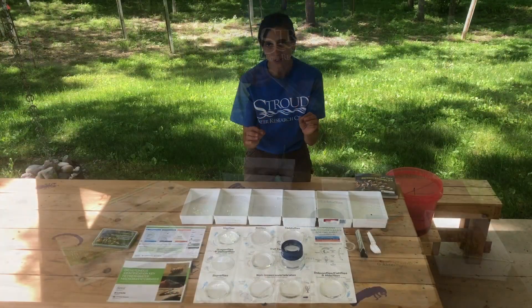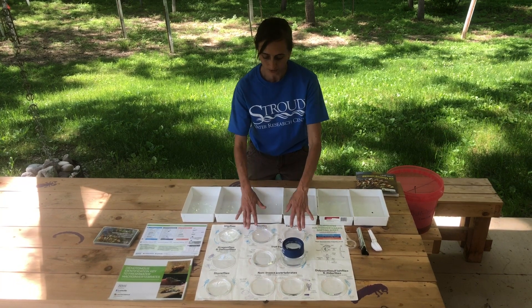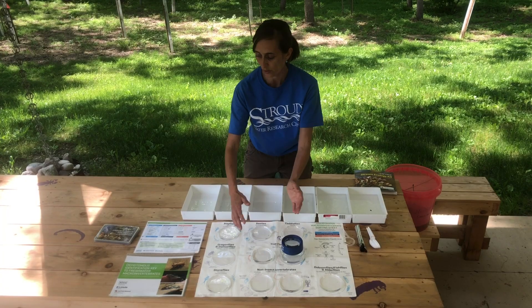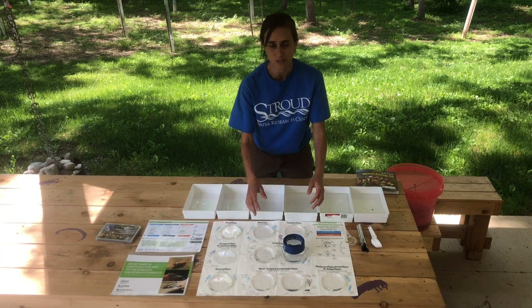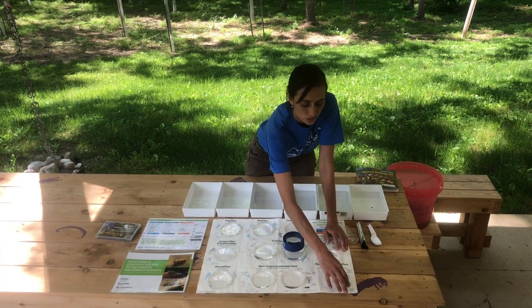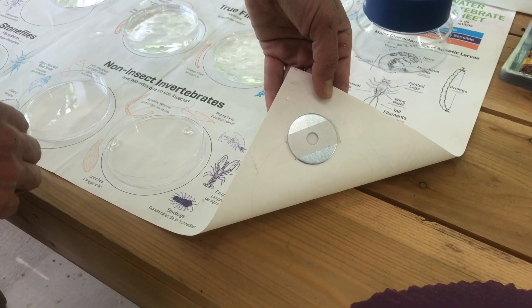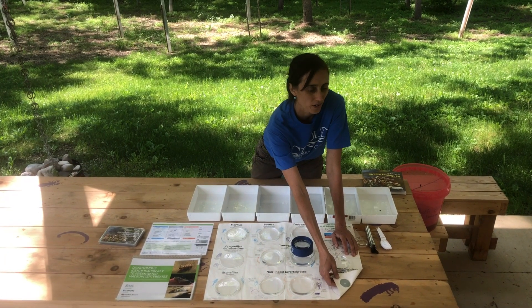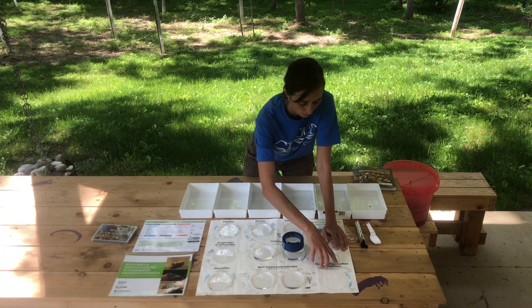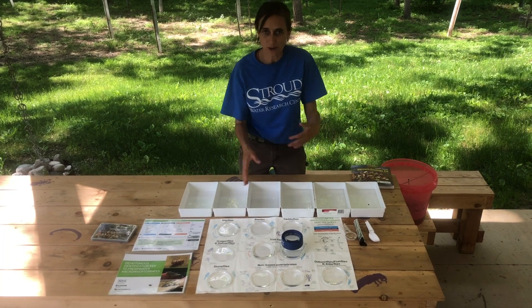The big blue lens fits over the petri dishes so you can look at the macro invertebrates up close for seeing those tiny body parts. You'll need your petri dishes filled with creek water — I have them here on our sorting sheet, which corresponds with the key and the biotic index with those three sensitivity groups. We've put a washer on every corner to help weigh it down, since they still blow away even with petri dishes on top. That'll get you started into sorting and ID, and now we'll walk through that process.